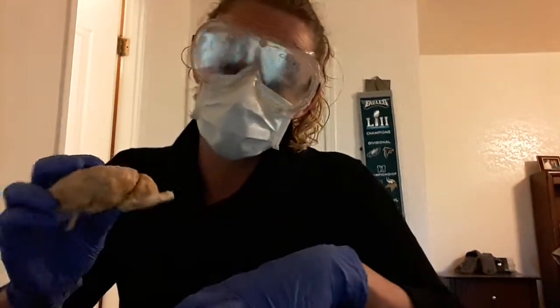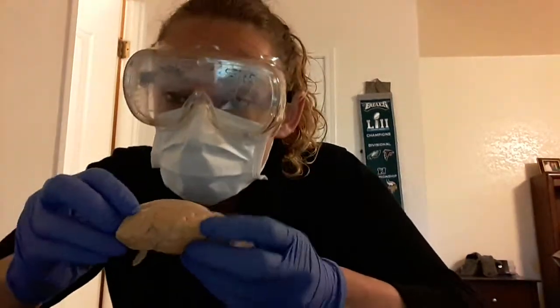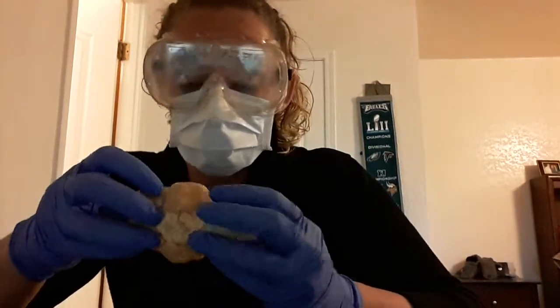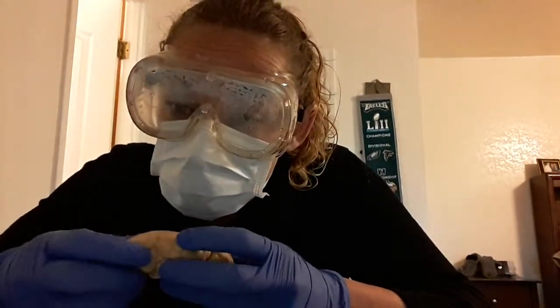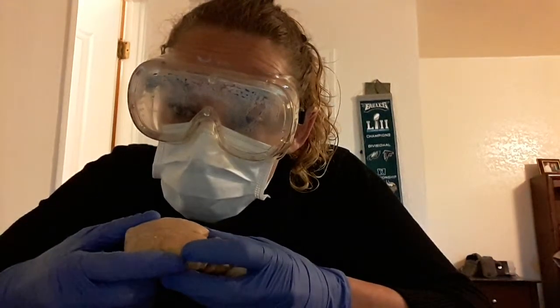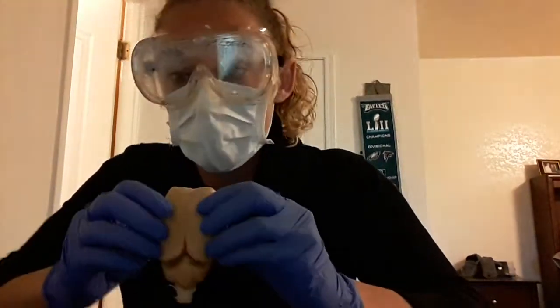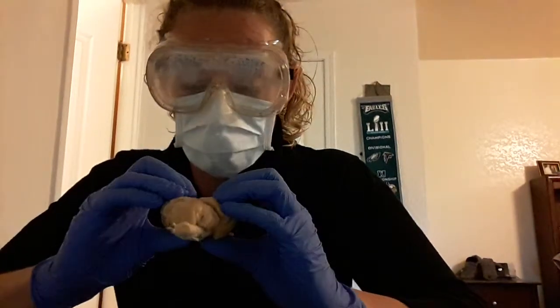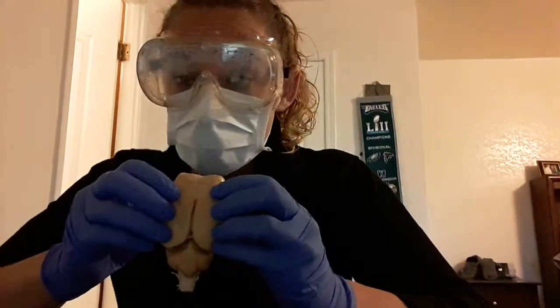So you have the gyri of the brain, which are the ridges. So there's quite a few in here, ridges all over. Next you have the sulcus, or sulci, and those are going to be the lines that you can see. I think that's a good example there, the lines that go through it. The longitudinal fissure is this line that goes right through here. So I can actually separate the brain. Later I'm going to cut down that and cut it into two hemispheres. So it separates the right and left brain.